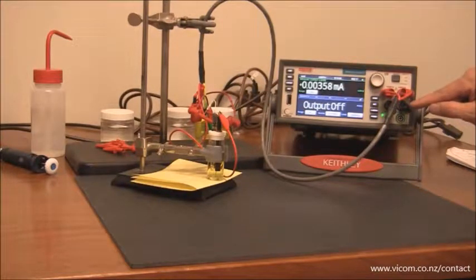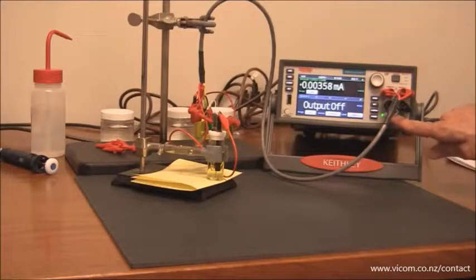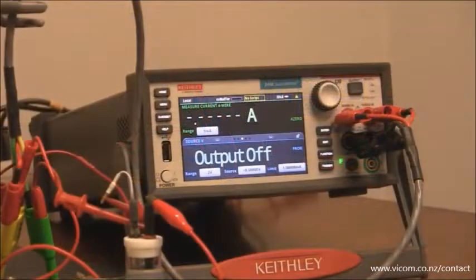I have the load terminal connected to the working electrode and I have the sense load terminal connected to the reference electrode. So let's run the experiment. Here you can see the electrolytic cell is all connected.